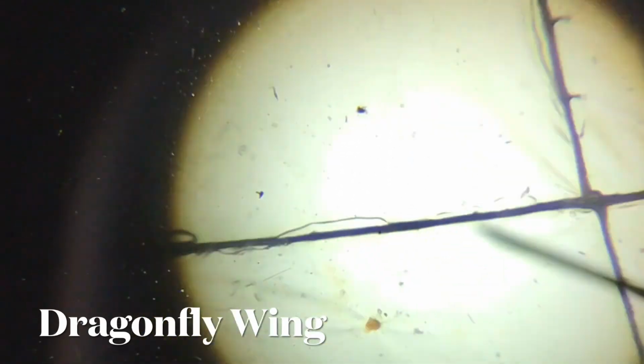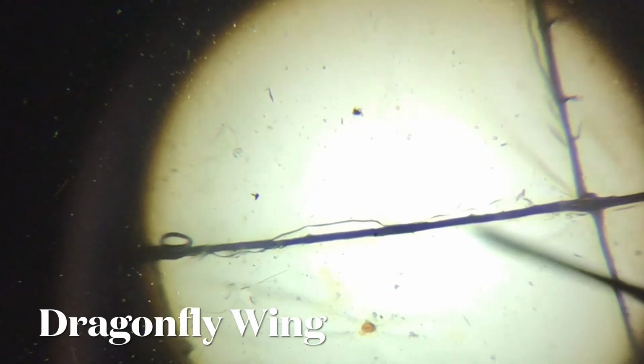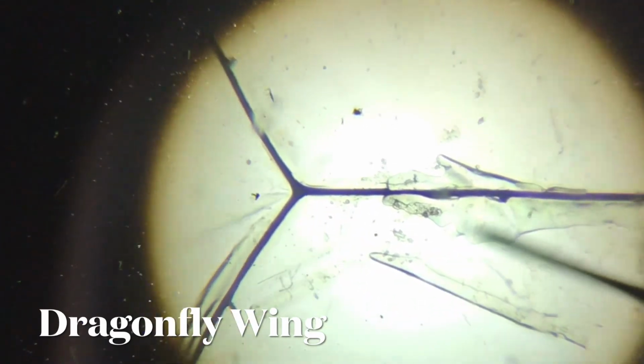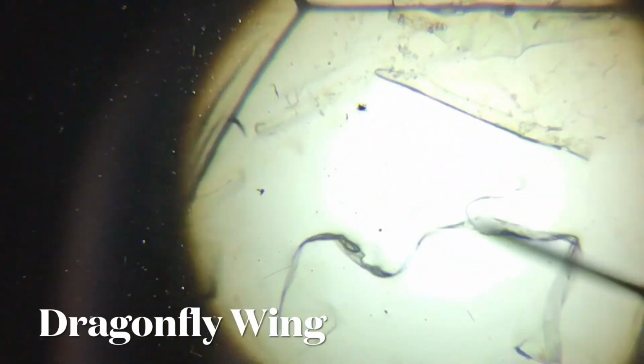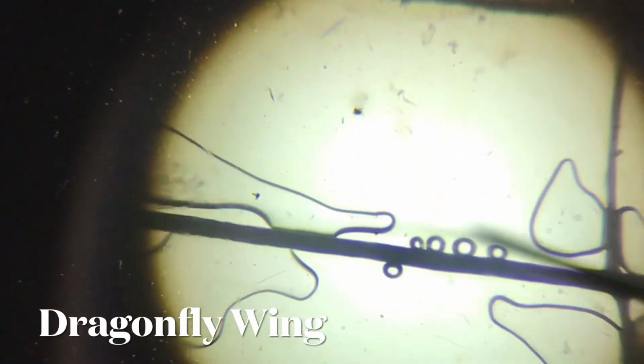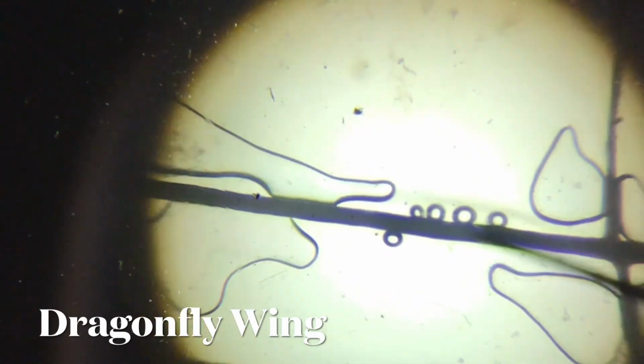Insects usually have very fine stiff hairs on their legs to help them cling to walls and even walk on walls very easily without falling off. You can see that the wing itself is mostly clear except for the joining part. So this is how a dragonfly's wing looks under the microscope.